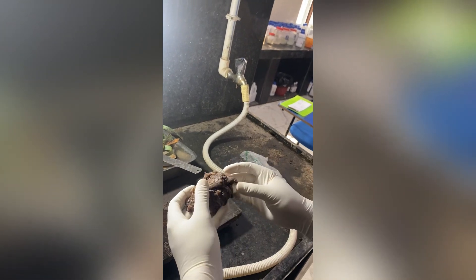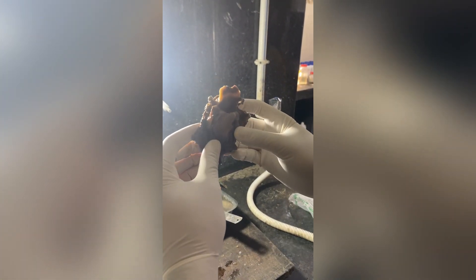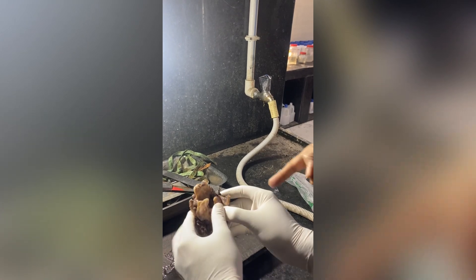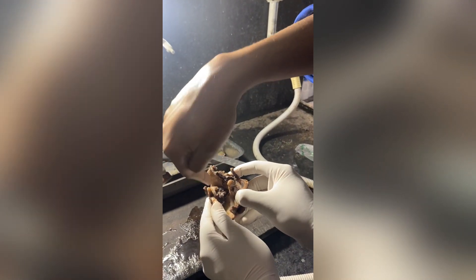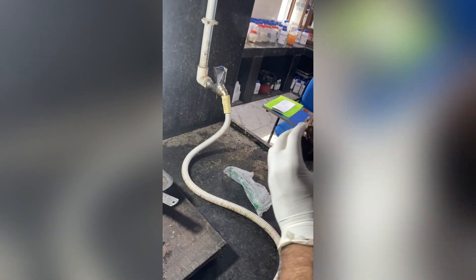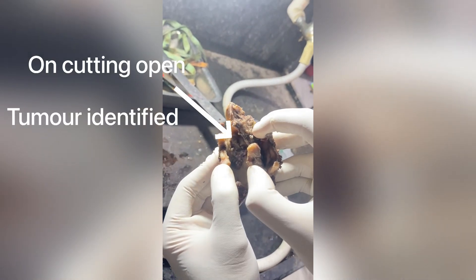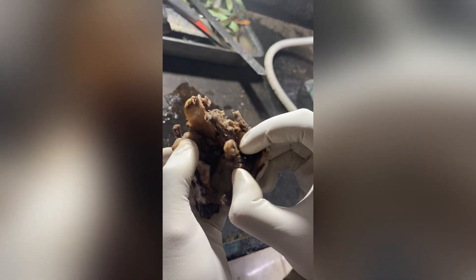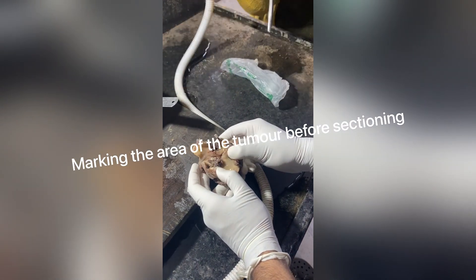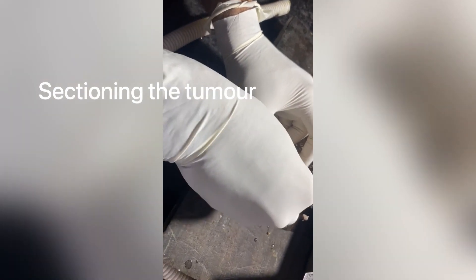Once we have oriented the specimen and hold it in anatomical position, we should try to dissect the specimen. Here, we can see a probable site for the development of cancer — a tumorous lesion can be seen. A gross evaluation of the growth or the lesion should be done, and it should preferably be inked before taking a section from the tumour.